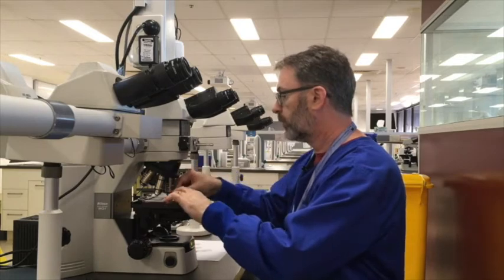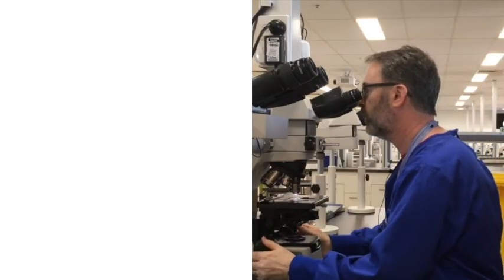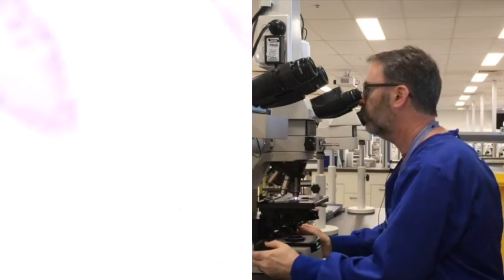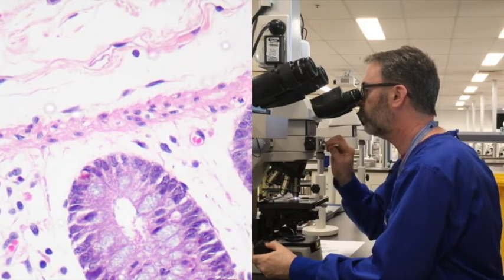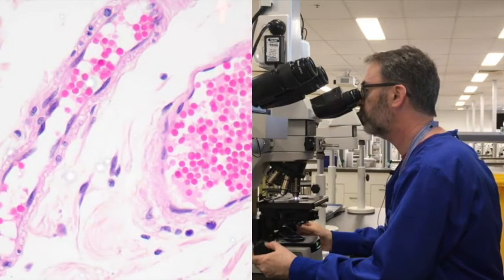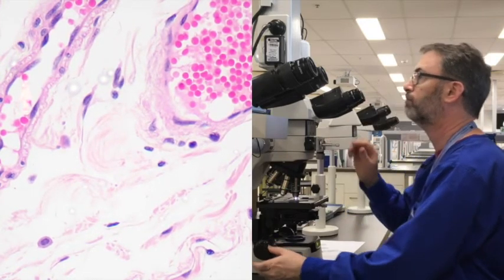Ideally, what you want is what we saw in the well-differentiated slide, so that when you then combine that with your eosin for 2 minutes, you end up achieving the right balance where you have nice bright pink within areas like smooth muscle and within red blood cells. We expect it to be nice and bright, but at the same time, having a really nice intensity of nuclear staining as well. Great. So if you do that, you should have no problems.